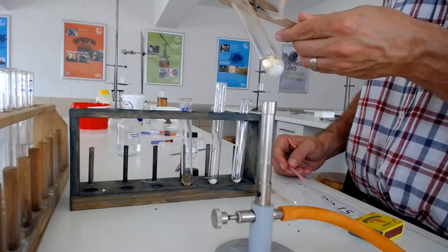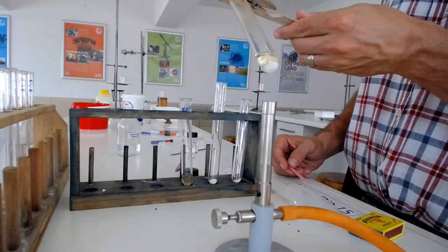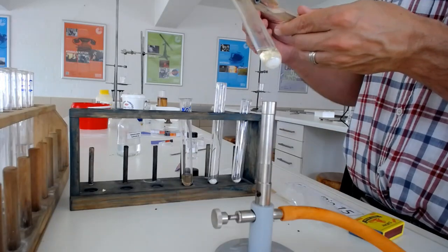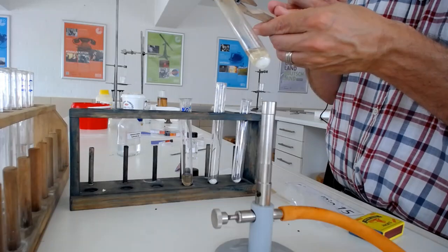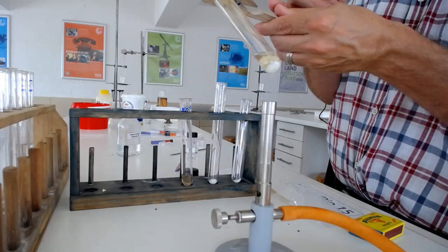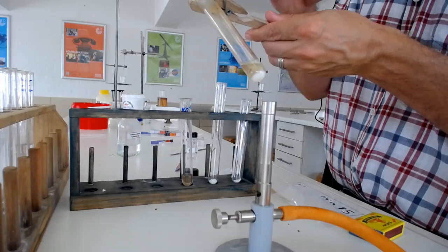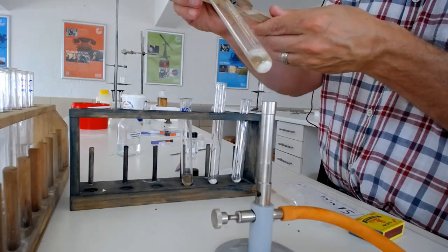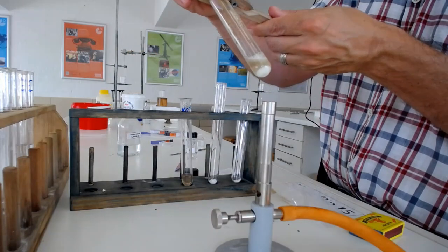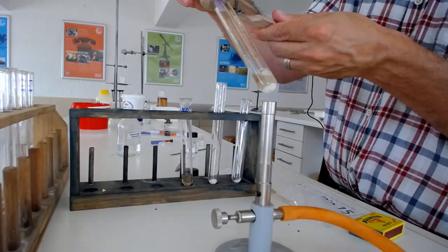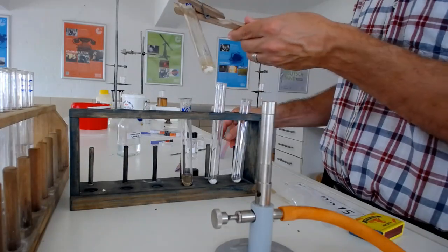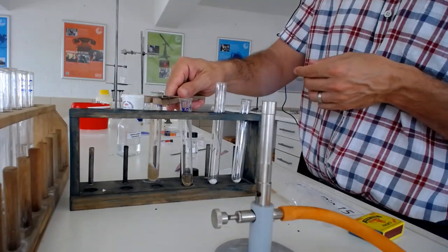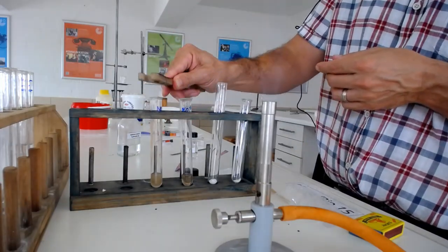Let's just see whether this gives me the same type of test, and it should. Again, you would notice that moisture, there's some water vapor immediately forming on the side over there. And let's just test this and you can see, wow, what a brilliant positive test immediately that you get.